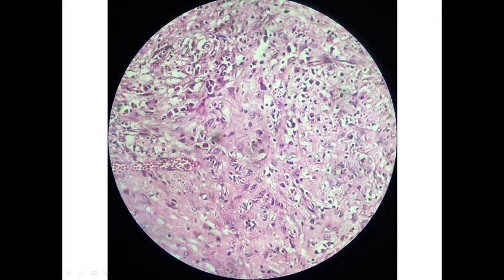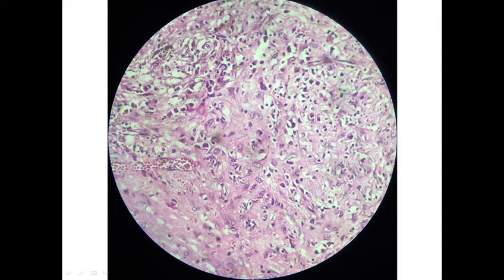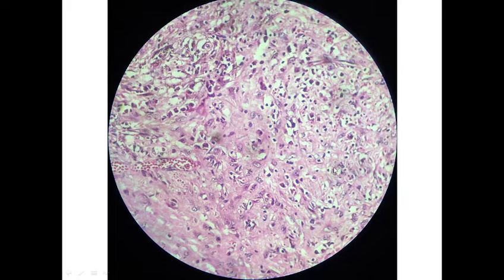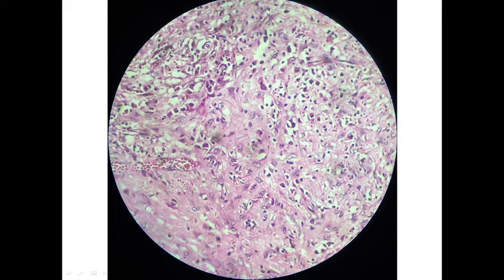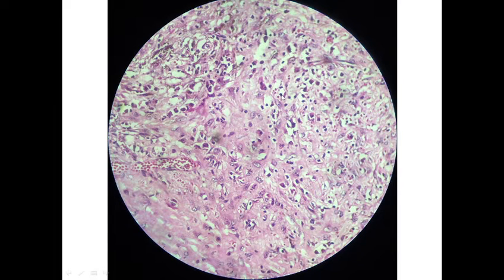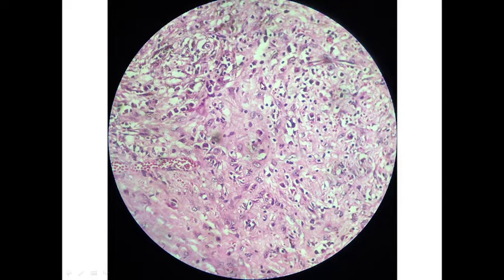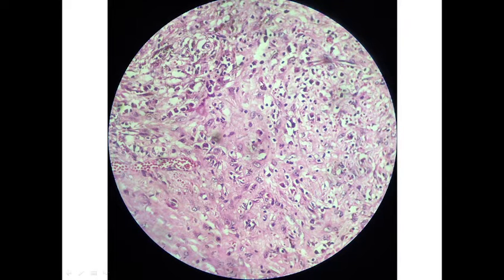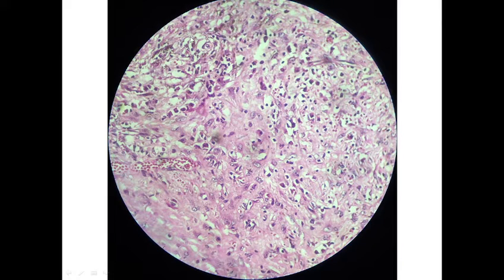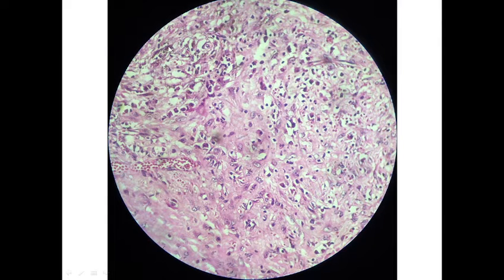Here, the high-power view of the stroma shows plump myofibroblasts and inflammatory cells composed of lymphocytes, some plasma cells containing eccentric nucleus and perinuclear halo, and some siderophages containing pigments.